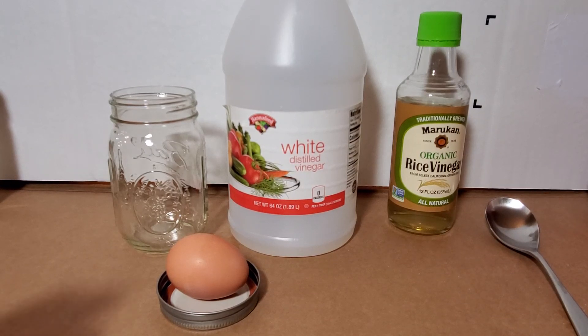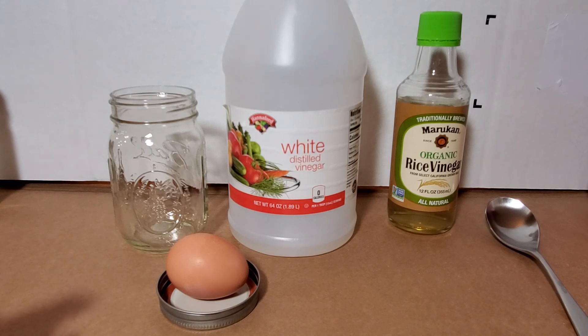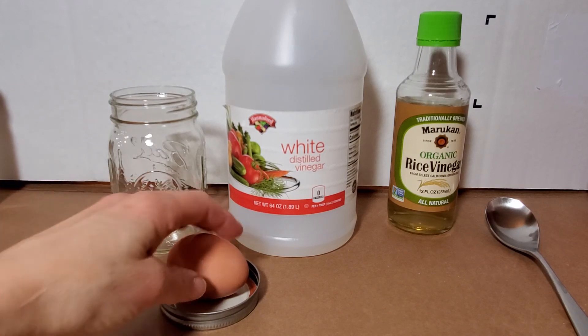Hello everyone, this is Mrs. Rowe and I am about to show you how to set up the egg osmosis lab that we're going to be working on later this week. So for today it's just getting it soaking so that we can get the shell off.